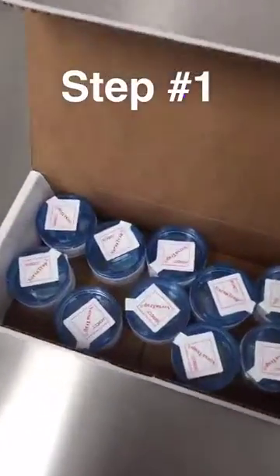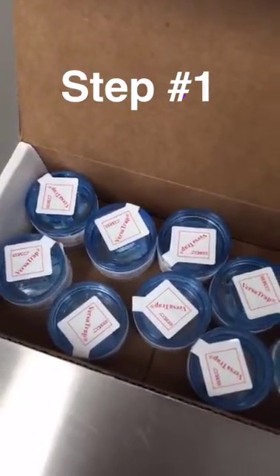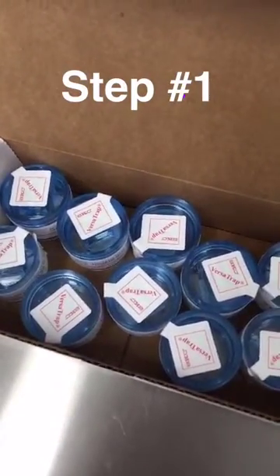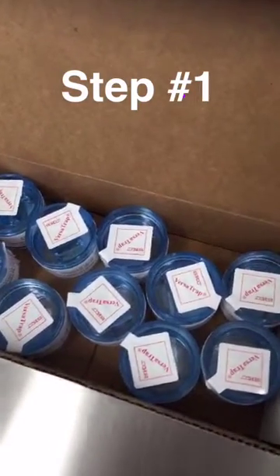Step 1 involves us sending these aerosol spore traps out to building inspectors, occupational hygienists, health inspectors, insurance assessors, or property managers.